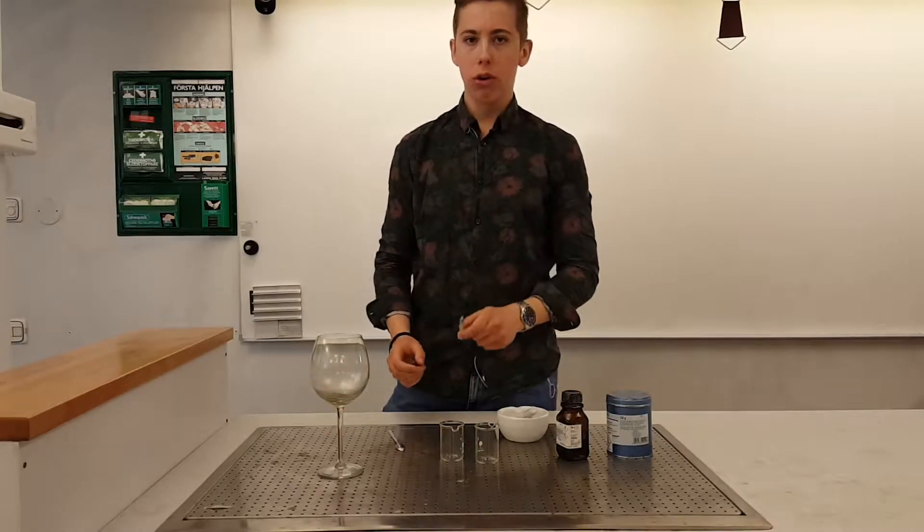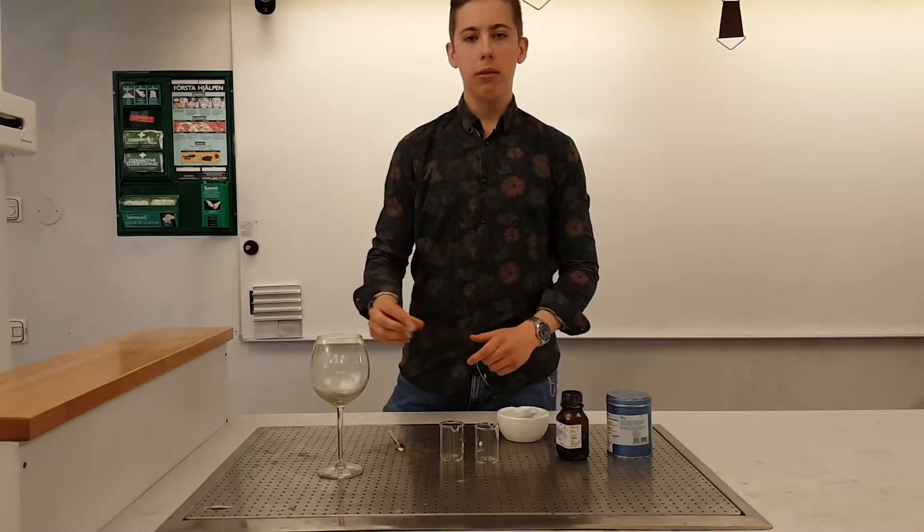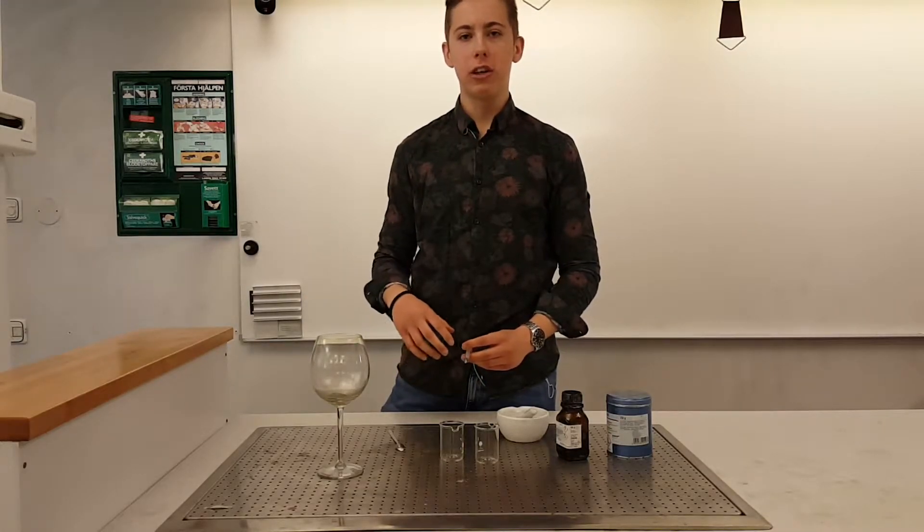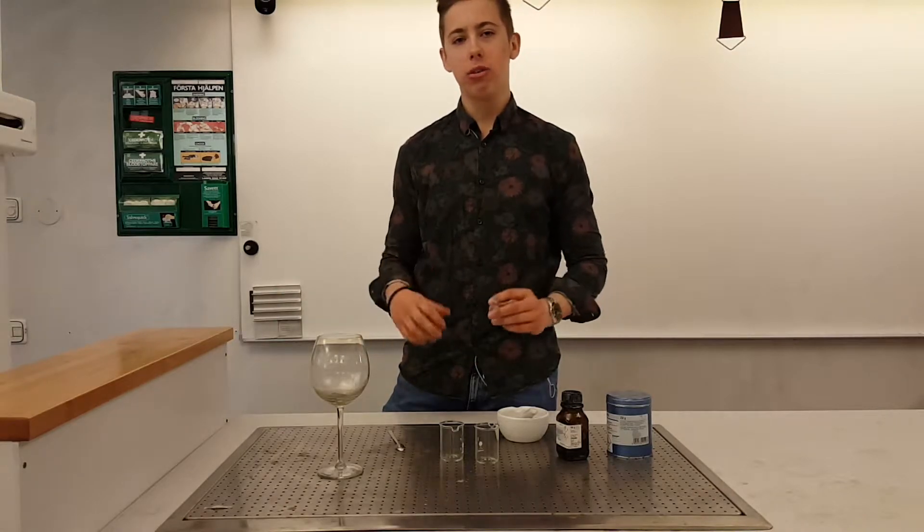We're going to put just two drops of water in here and it will produce a thick purple smoke that can be seen from far away if you ever get stuck on an island and need someone to come and save you.